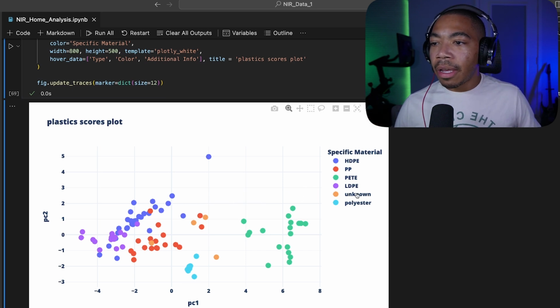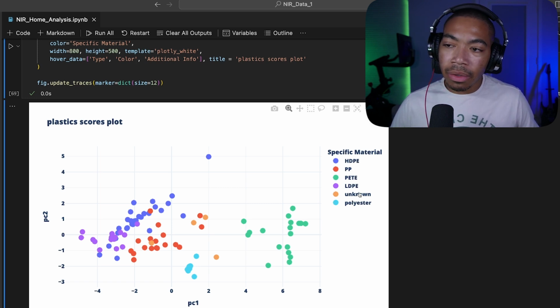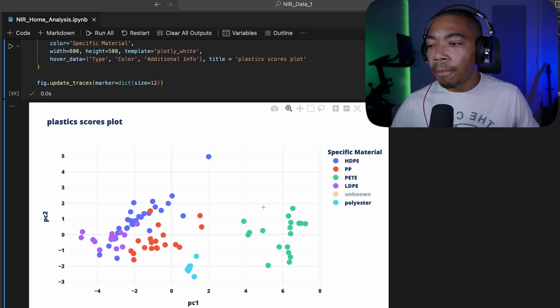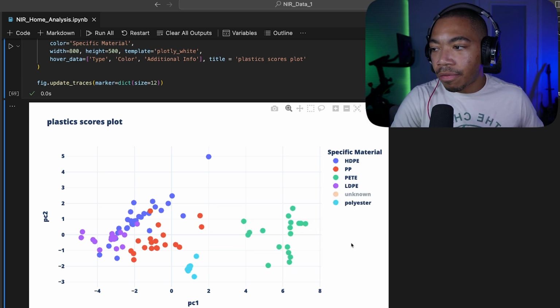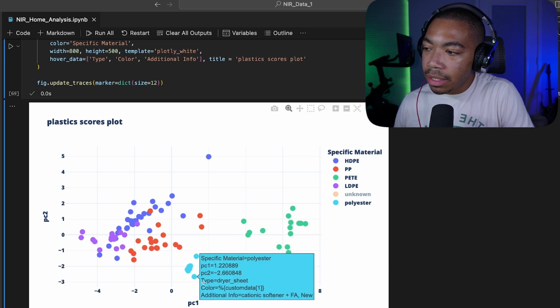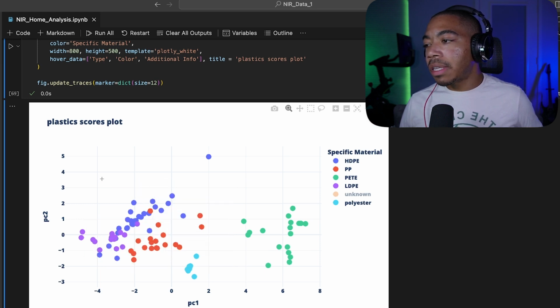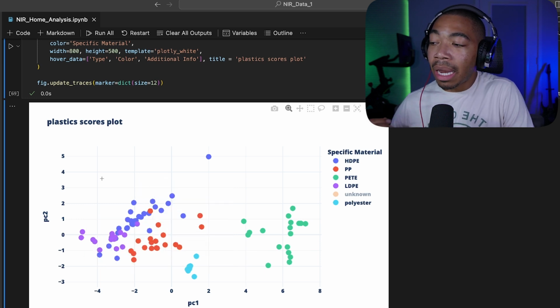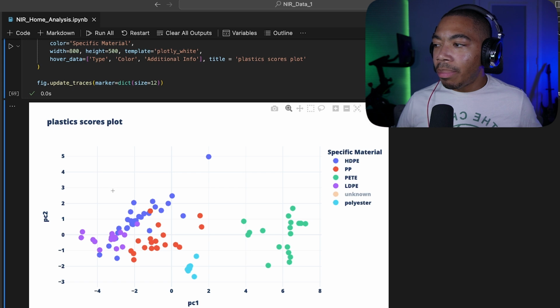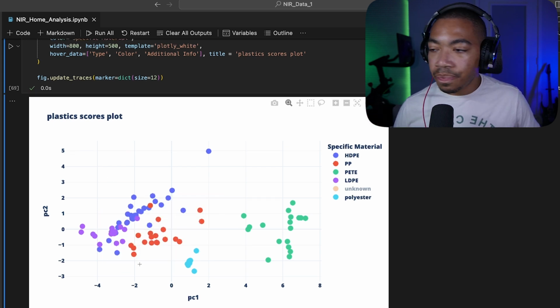When we do that, and we're filtering for just the values that have a relatively high correlation value, you can see we have a few plastics here. We have our polyethylene, we have our polypropylene, we have polyester, and we have this unknown that I'll just remove from the plot now. And we can see that the PETE samples are quite separate from the rest of the materials. We have polyester, which is also a nice dense cluster. And then we have polypropylene here in red. And on the left side, we have our low and high density polyethylene samples that appear to be overlapped when we just look at PC1 versus 2.